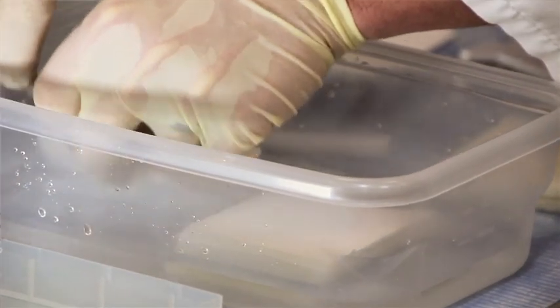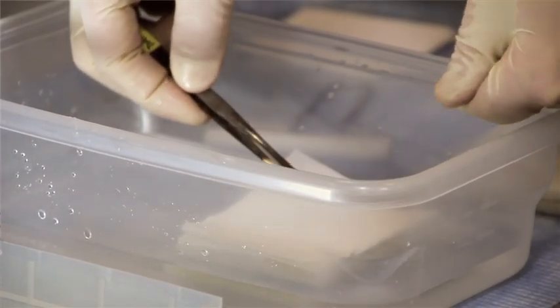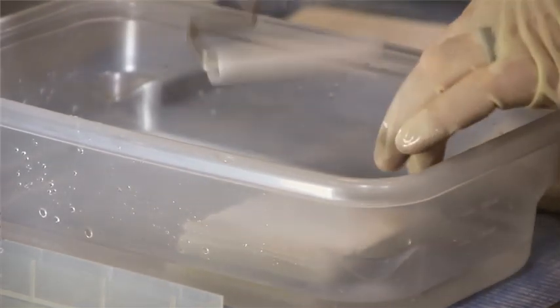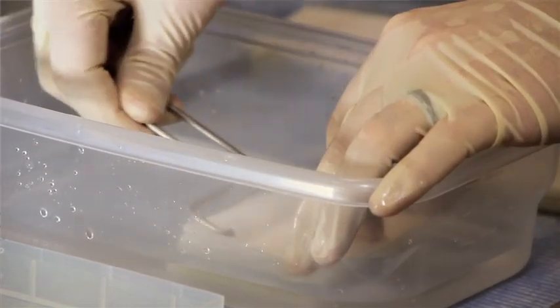Then on top of that, lay the final piece of filter paper, and then I'm going to use this roller again to make sure that I get out any remaining bubbles.